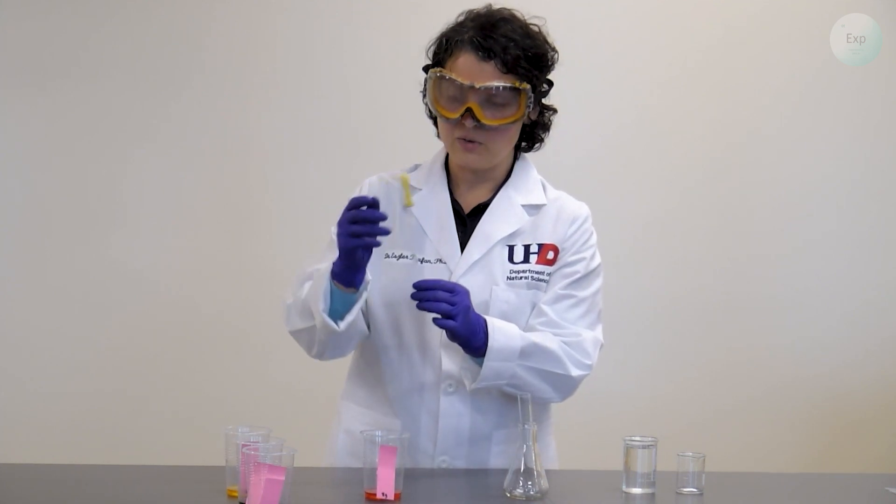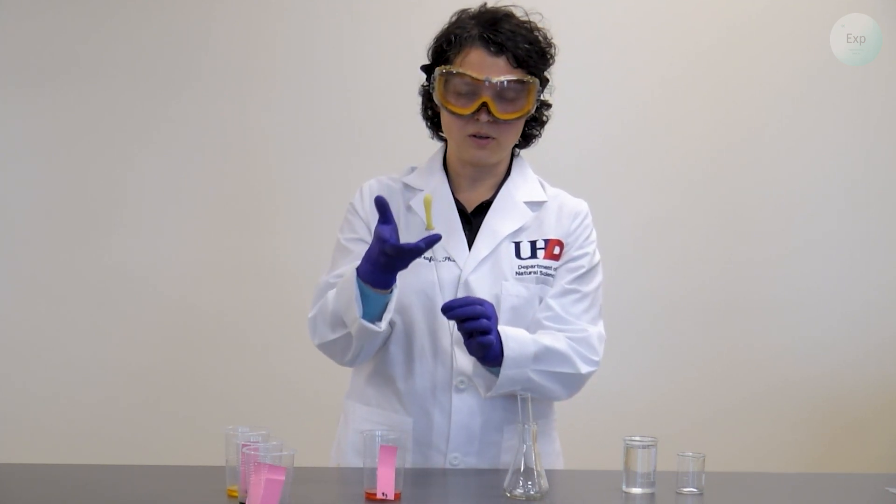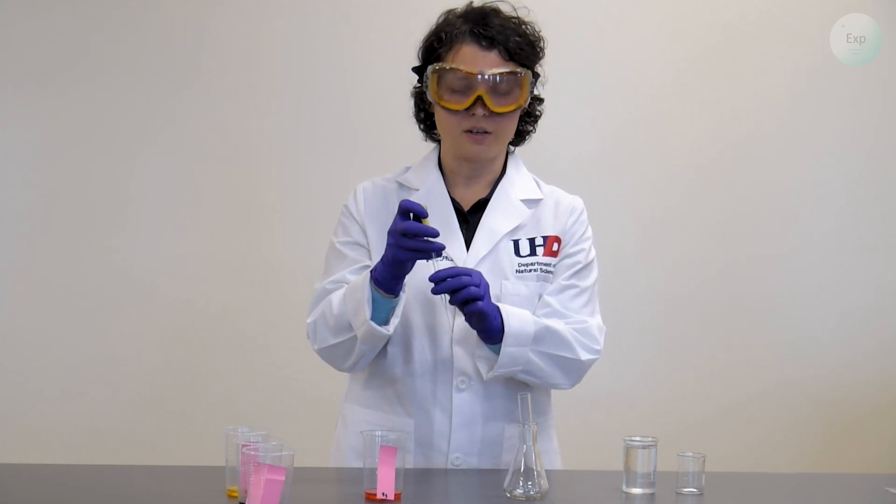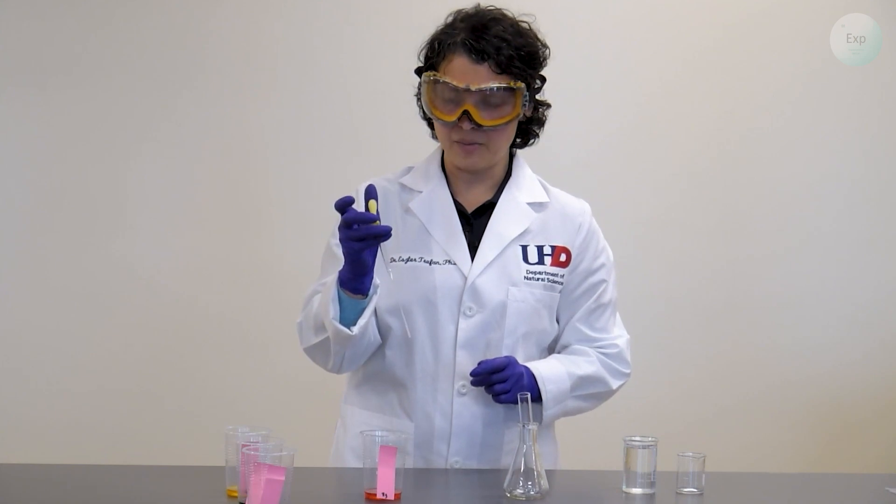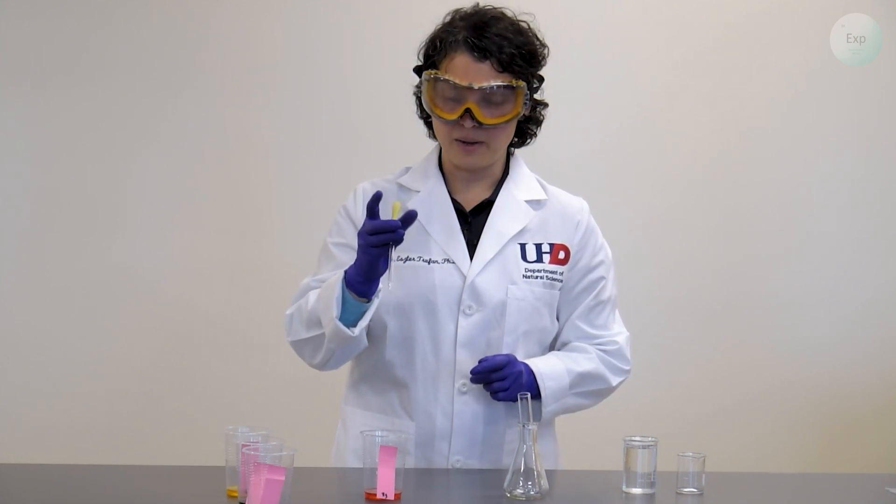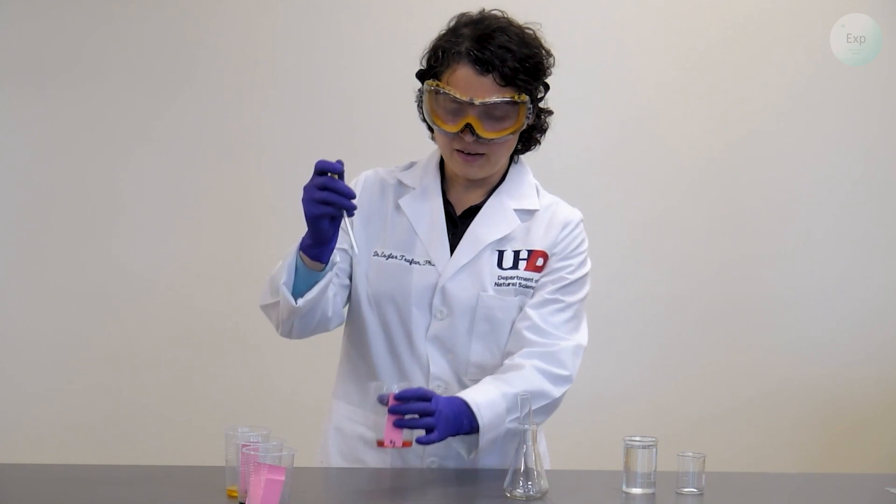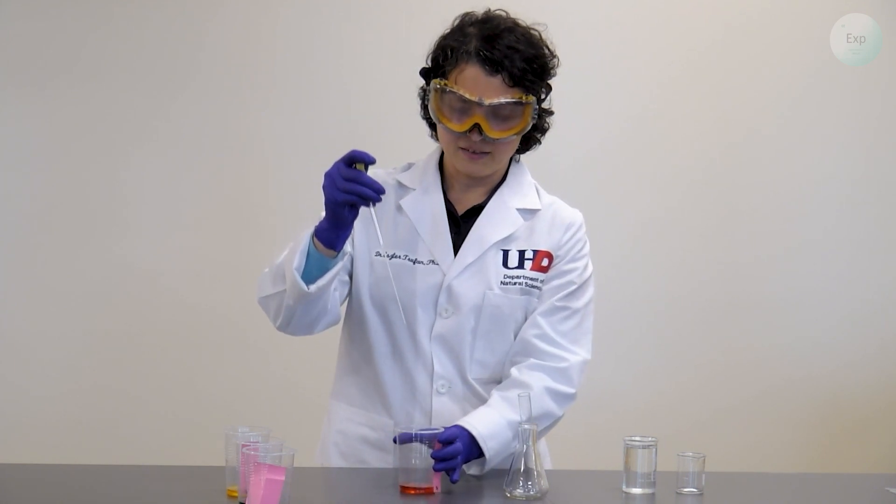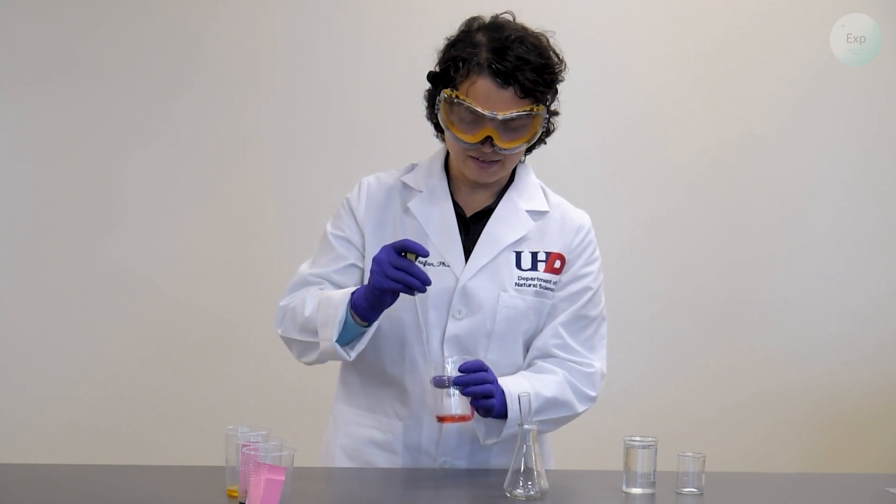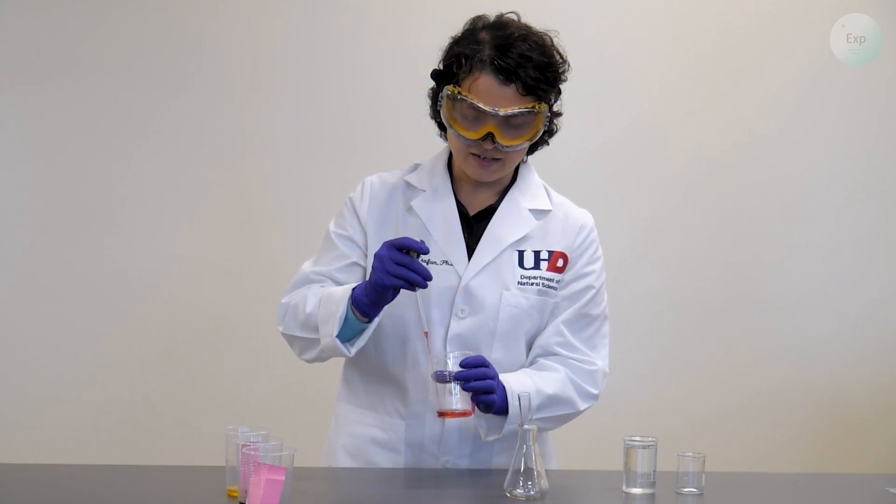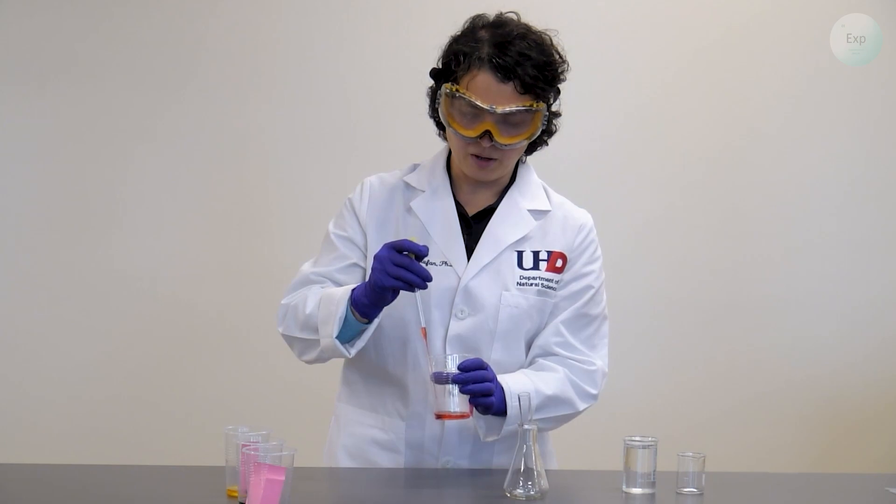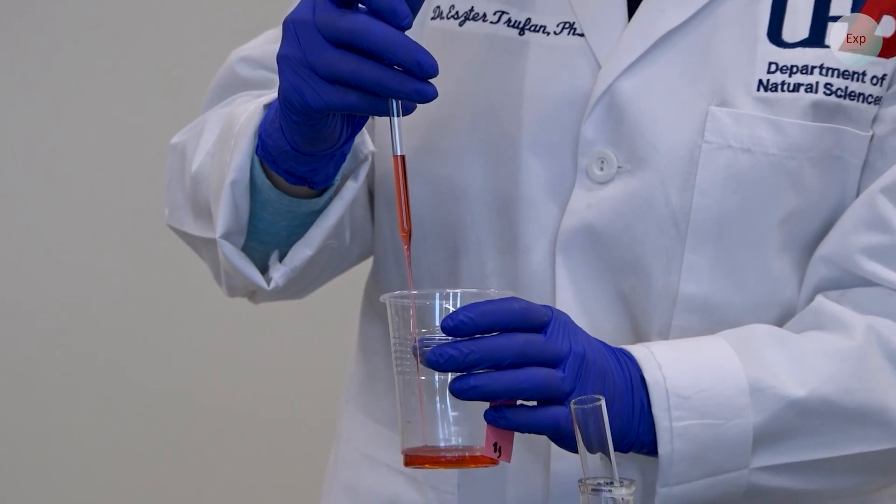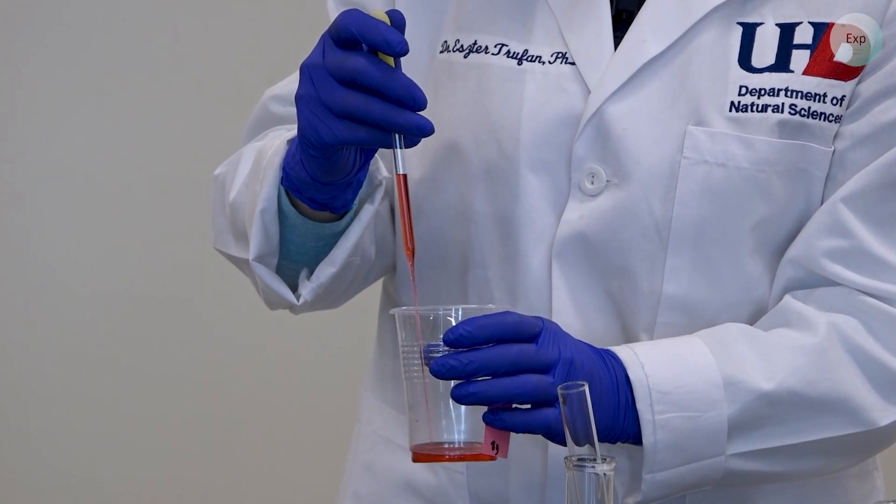I will use my pipette, control the glass portion with two fingers and the bulb with other two. This will allow me to separate the control of the pipette and the control of the bulb. Then I am going to squeeze the pipette bulb and place the tip of my pipette in the solution and then as I slowly release my grip on the bulb it will pull up the red solution. And because the red solution is rather viscous this may take a minute.